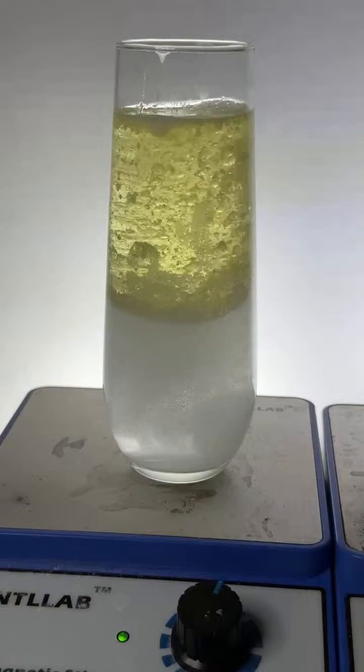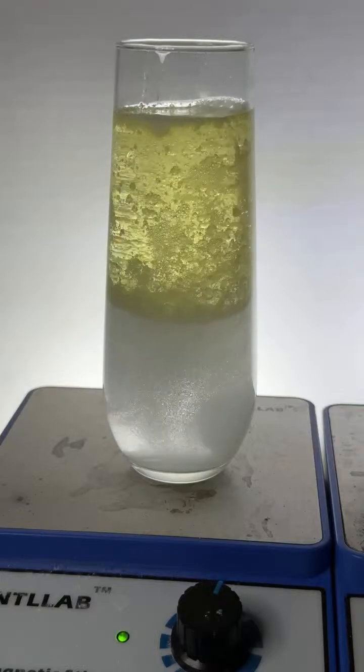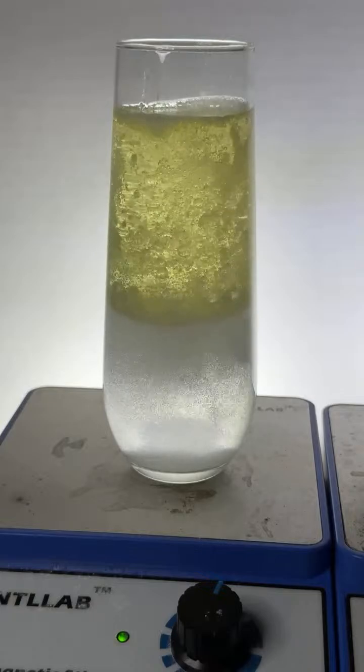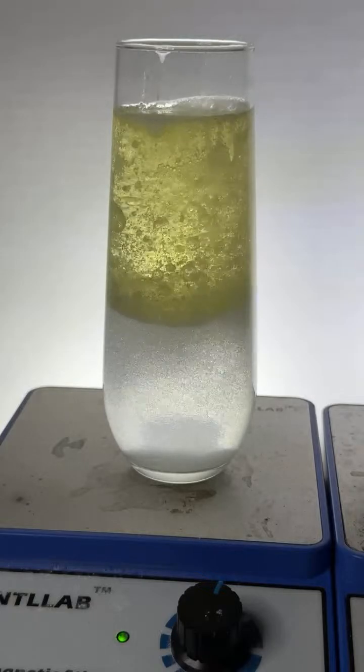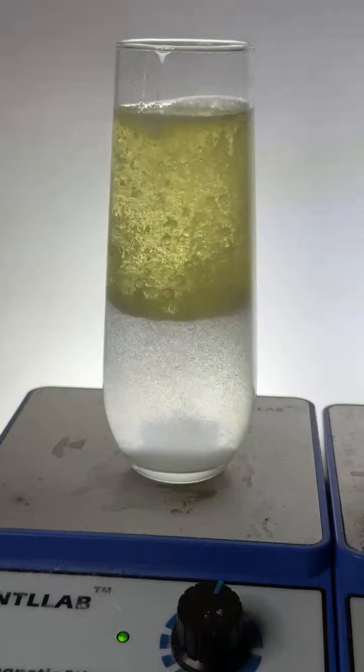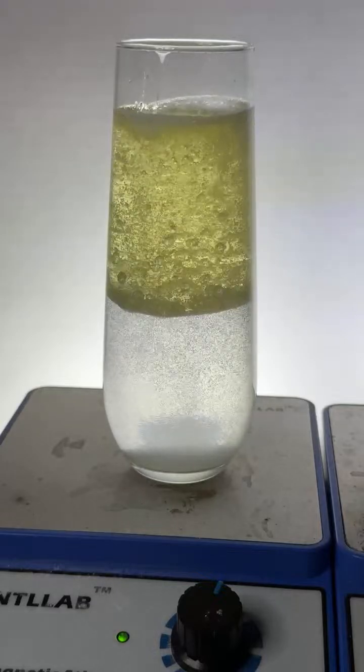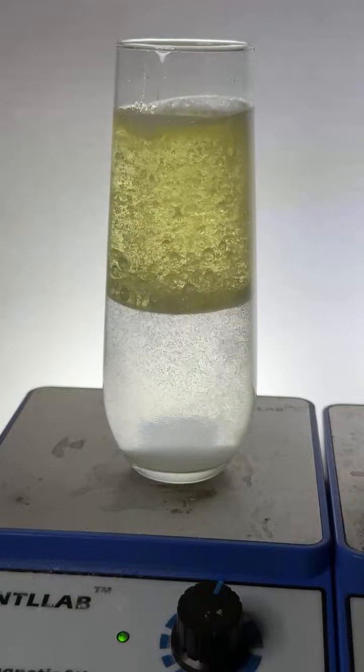It is still going. Can I do a dehydration reaction? I can if I want, Mussin. I dropped in an Alka-Seltzer tablet, Diane. Dropped some phenolphthalein. I apologize, Dawasish, I do not have phenolphthalein. I do have universal indicator.